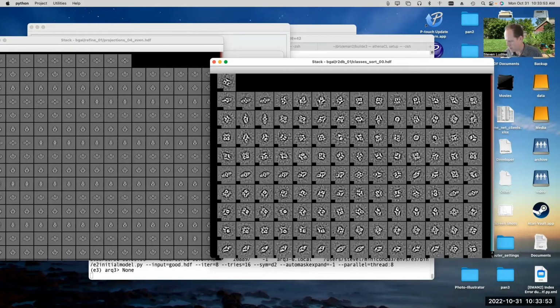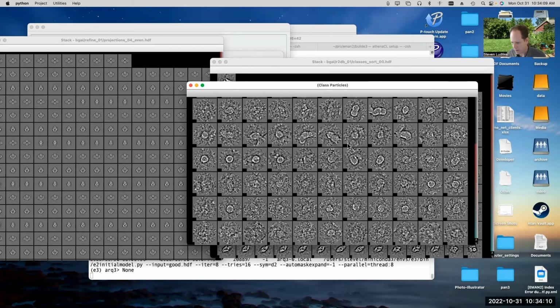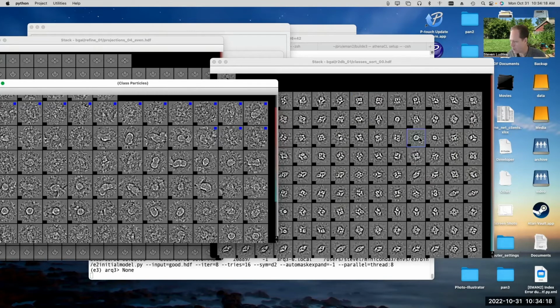You can sort of see the central lobe and you can see this little bit off to the side. This is actually an important view. If this is the first time you'd ever looked at this data, you would probably double click on one of these and conclude that, oh, that's primarily ice contamination, I just want to get rid of all of that. And you might wind up throwing away the particles that were in that orientation. And without that orientation, it's actually kind of hard for it to come up with an initial model because it's important.